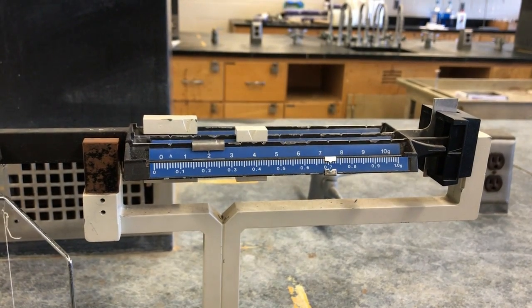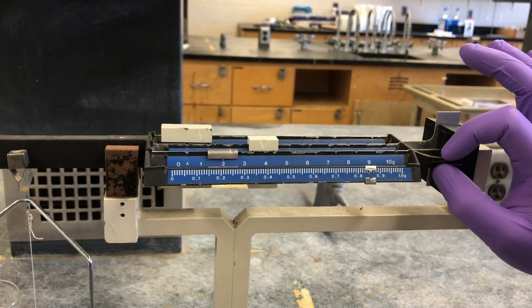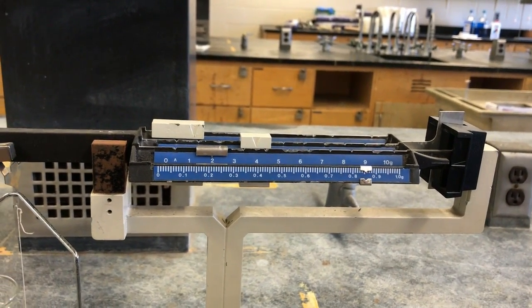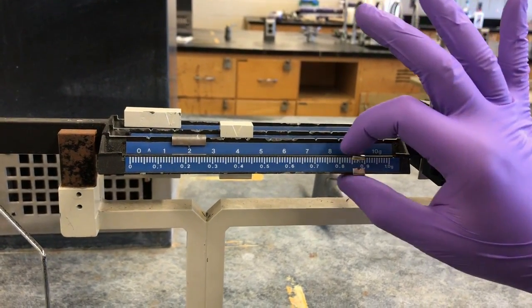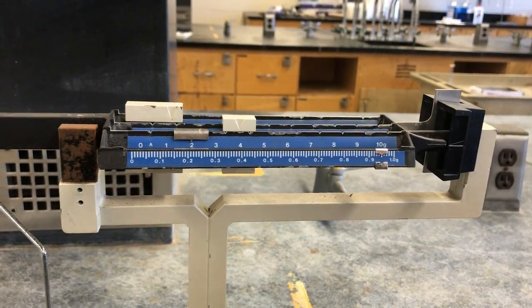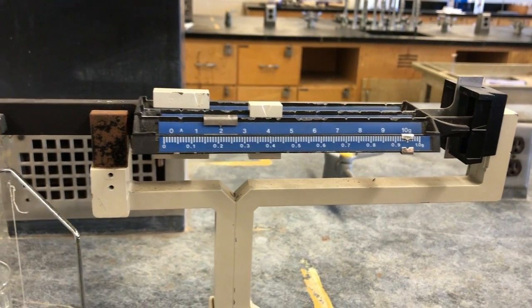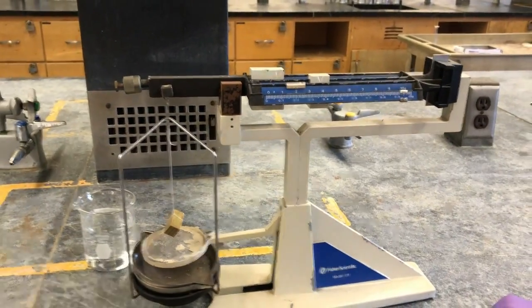It's a little too much. It's a little too high. That's good. Yeah, that's great. All right, so that's how you do it.